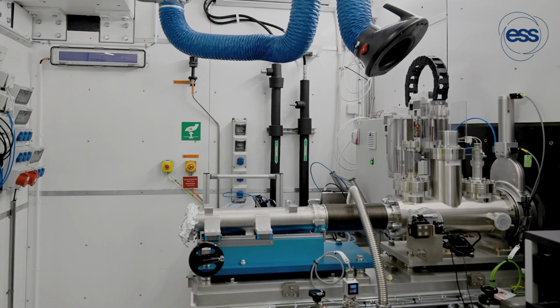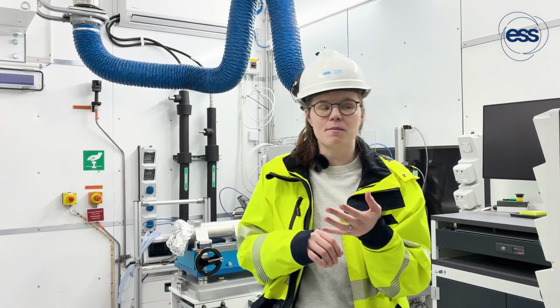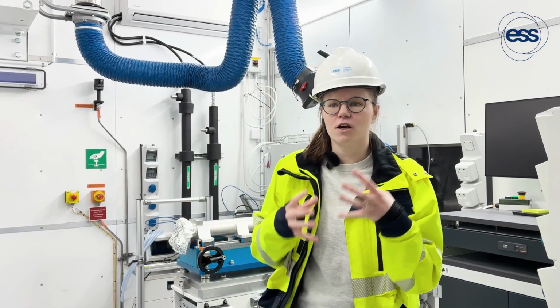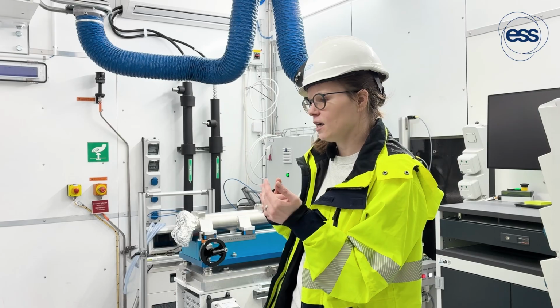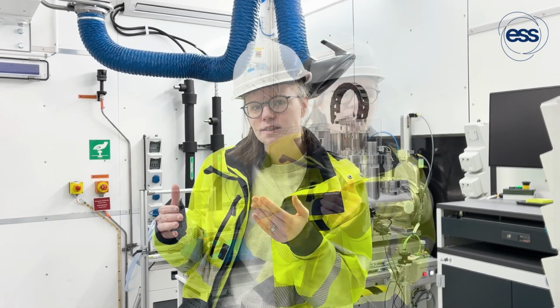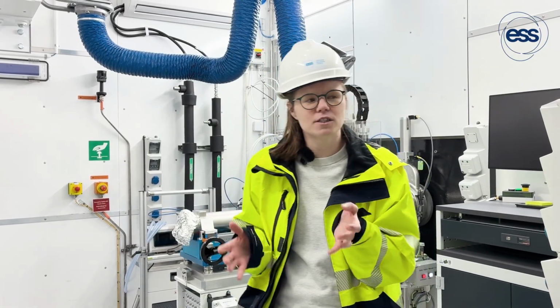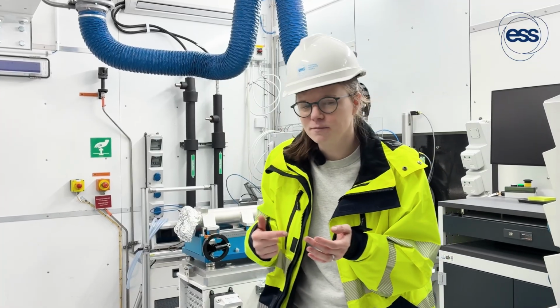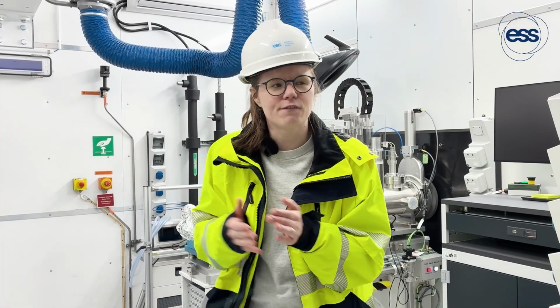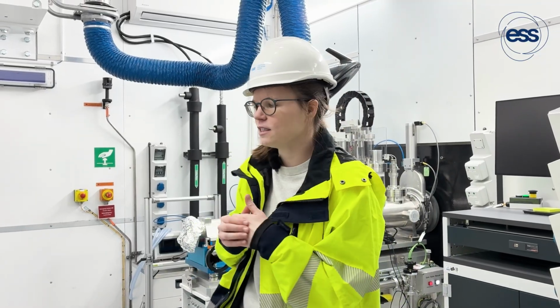That'll mean that we have our samples placed here. We can have them under different conditions. So they might be under flow, they could be undergoing dramatic temperature changes, or pressure changes, all of these things that might happen on reasonably fast timescales. You could easily measure this at an X-ray source if your sample environment allowed, but it's a lot more difficult at neutron sources because you either have to repeat the experiment many times, or you can't really get to those fast timescales. So our user community is particularly excited for that ability.